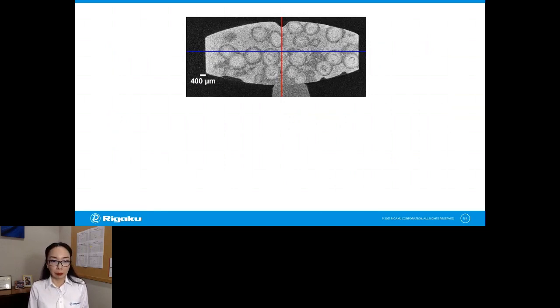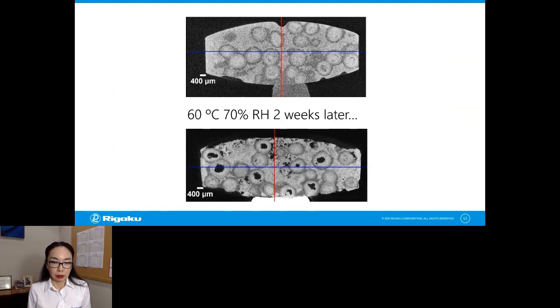At the beginning of the experiment, everything looked fine. Now, to simulate the situation where the package is broken and those tablets are left in a really bad condition, something like 60 degrees and 70% humidity, which is actually not too far from what we have in Texas in summer. But 2 weeks later, we just left it there for 2 weeks, and this is what the same tablet looked like. You see a lot of degradation going on, and all those black parts are gone. That's void. And even the core API that was surrounded by the slow dissolving matrix is gone.